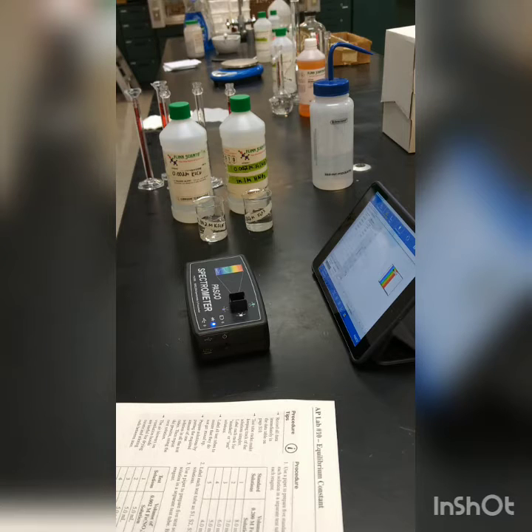So we've got 2 equal concentrations. We're going to make up the 5 different test solutions that are described in your packet. And then we're going to measure the absorbance, and that will tell us the concentration of the iron thiocyanate in that particular test solution. And then we can use that to find equilibrium. So I'll demonstrate one here on camera, and then I'll give you the rest of the data in a hard copy. Okay. So the first test solution, number 1, calls for 5 milliliters of 0.002 iron nitrate.